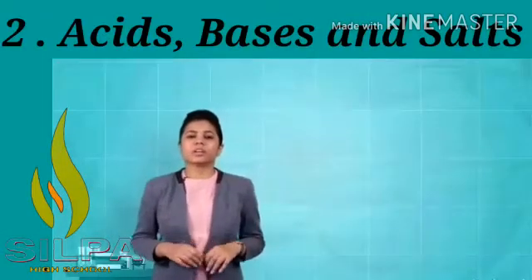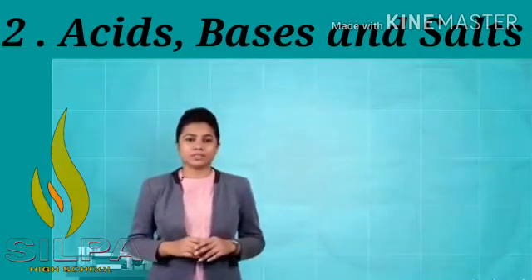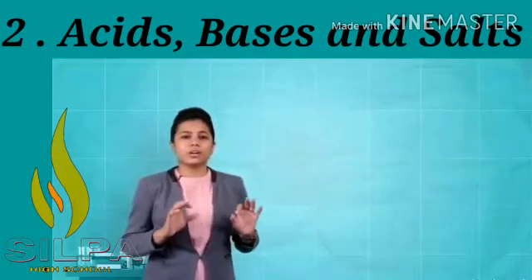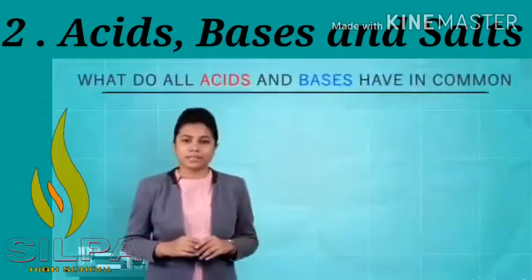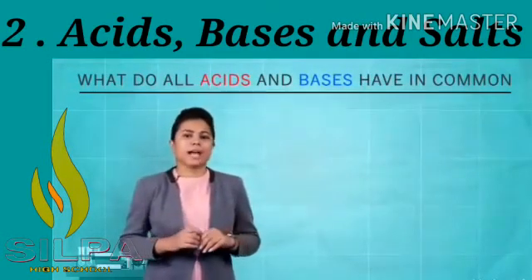Hello everyone. In the last videos, we have seen the chemical properties of acids and bases. So in this video, we are going to see what acids and bases have in common. For doing this, we are going to perform a simple activity.